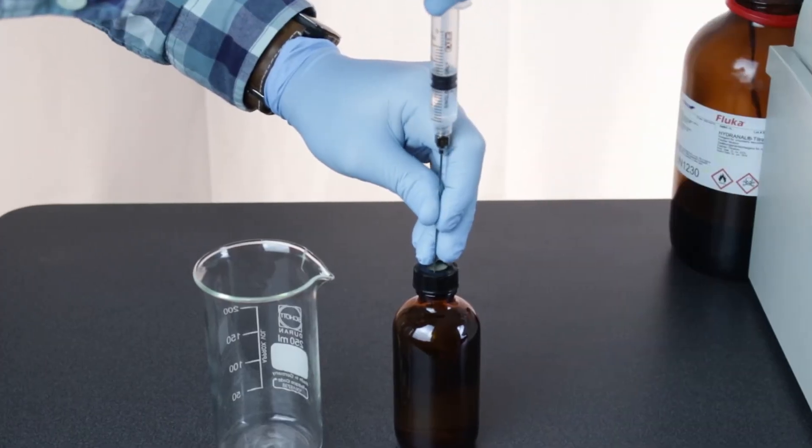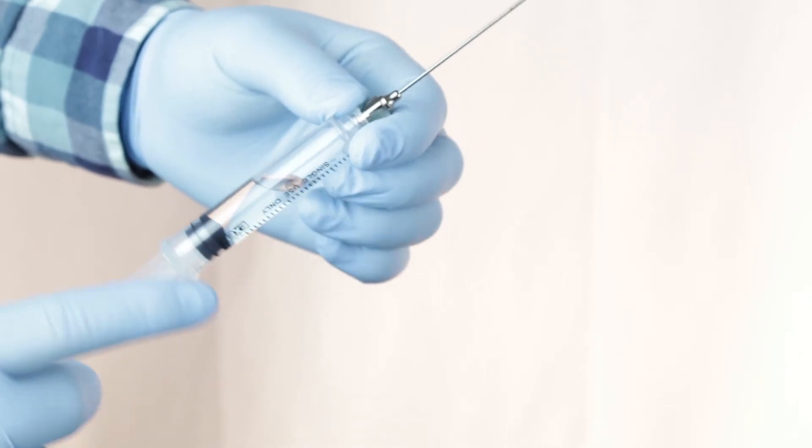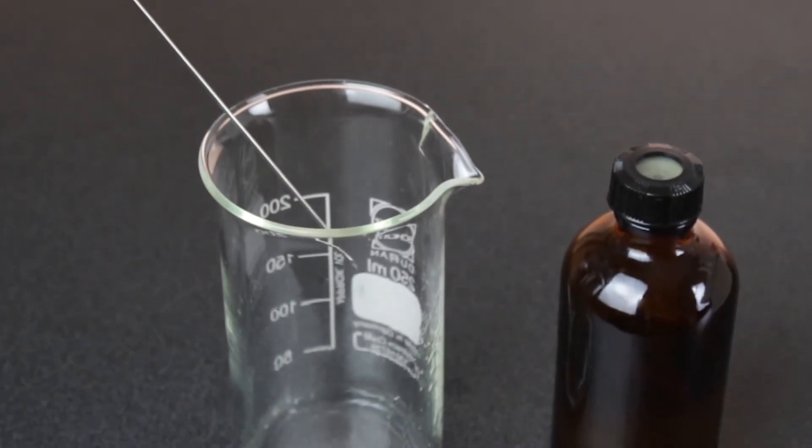Begin by drawing up a little sample to rinse the inside of the syringe. Discard that sample into a waste container. Now we can fill a syringe full of sample.